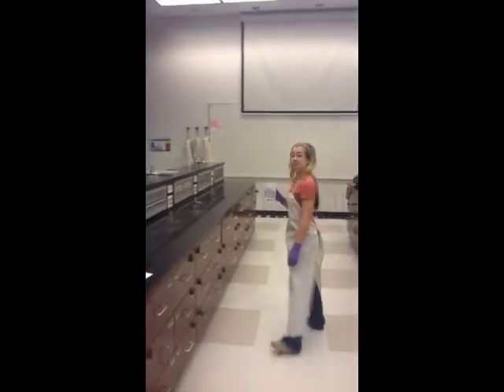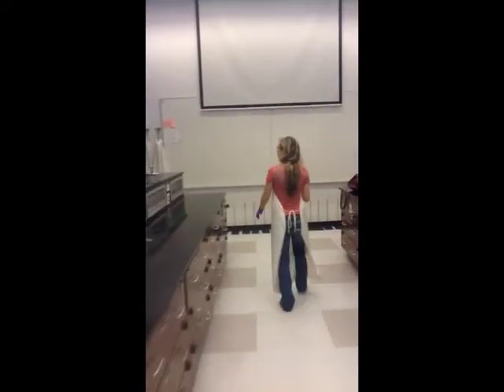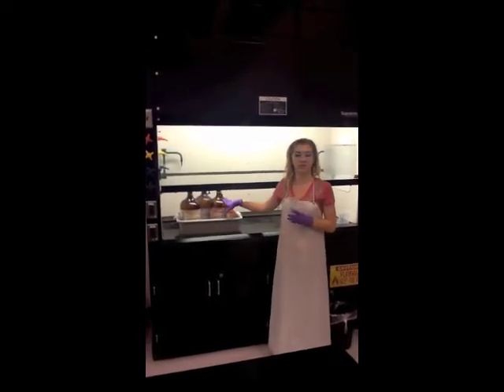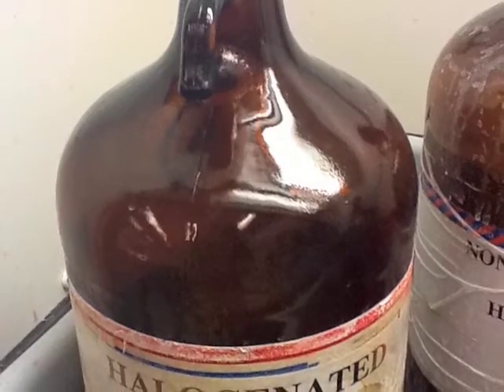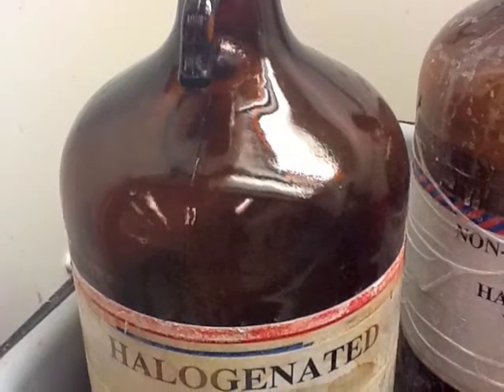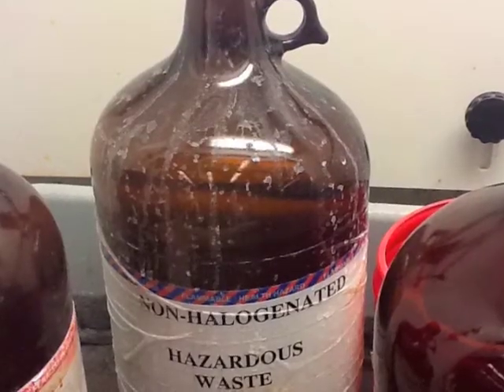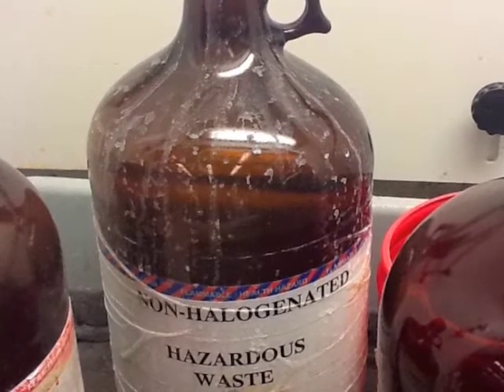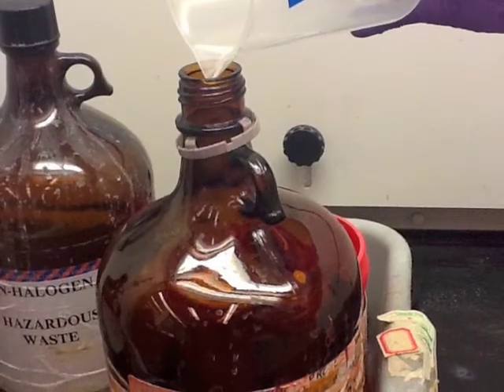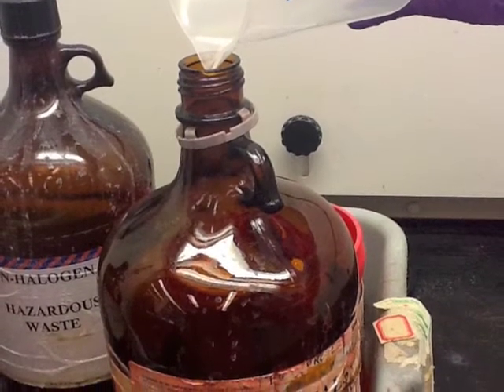You will need to dispose of all of your solutions carefully. If you collect everything in one beaker, make sure you are using the heavy metals hazardous waste bottle. If no catalysts are in your waste but oxidizers are, use the halogenated waste container. If the liquid has no oxidizer or catalyst in it, use the non-halogenated waste container. Using these rules for waste is very important, and using the fume hood is even more important.